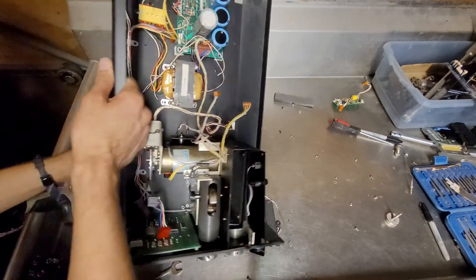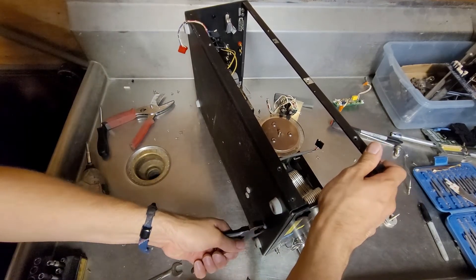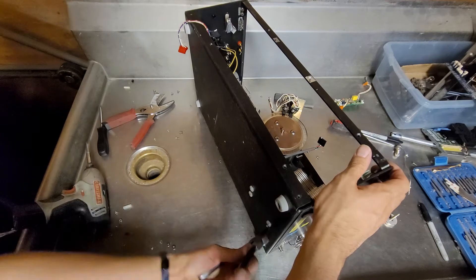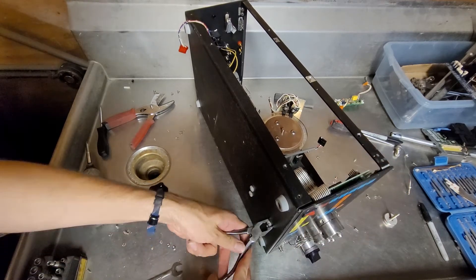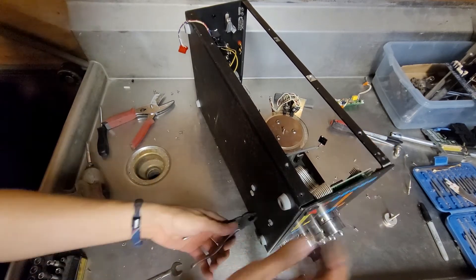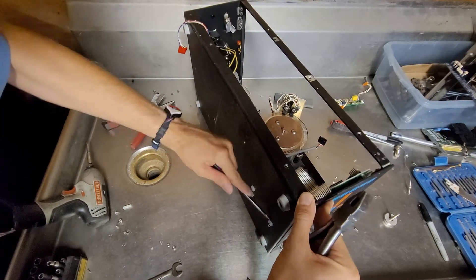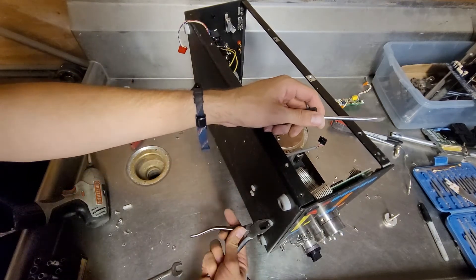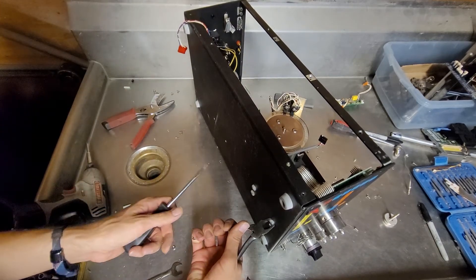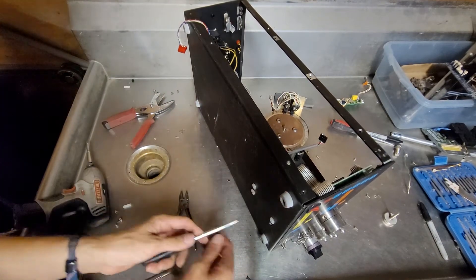These dang screws on the bottom are holding me up here. They're too soft to squeeze and loosen very easily — just wants to collapse. I think I'm just going to violence them off, pop it off with the screwdriver maybe. I'm guessing that they used these presumably nylon screws for vibration reasons.